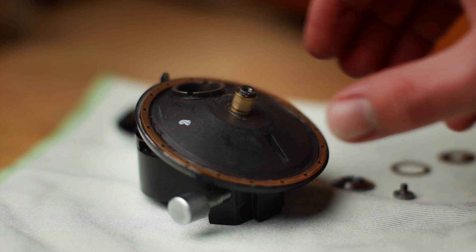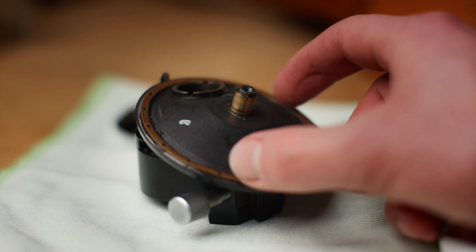Next, we reinstall the cleaned ball cage and place new balls of the correct size into it.